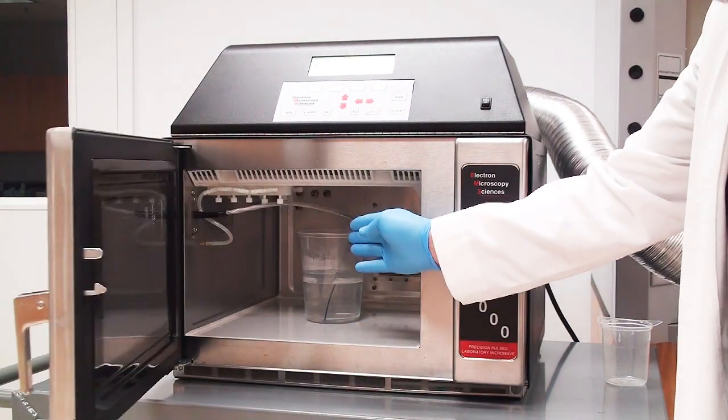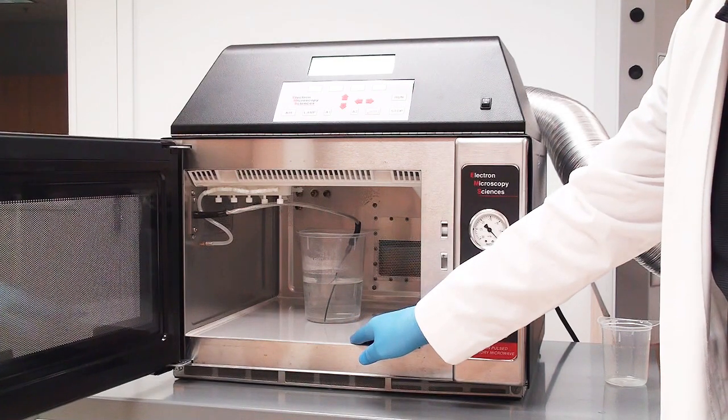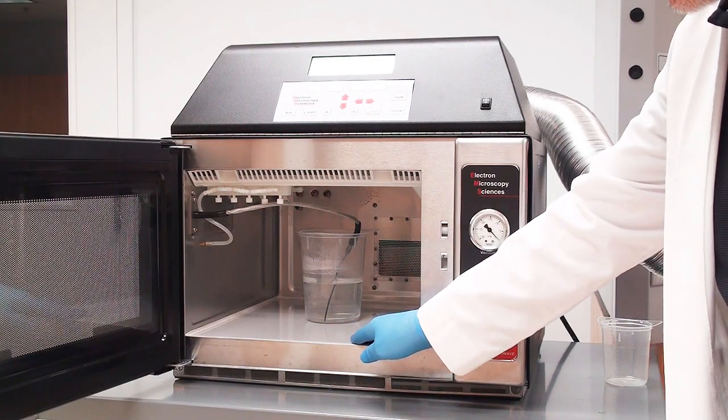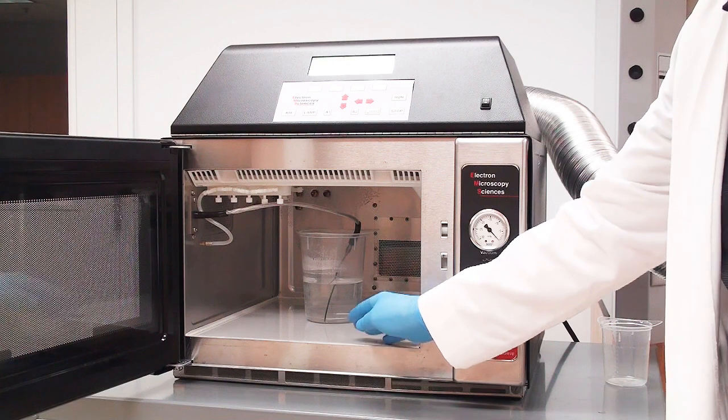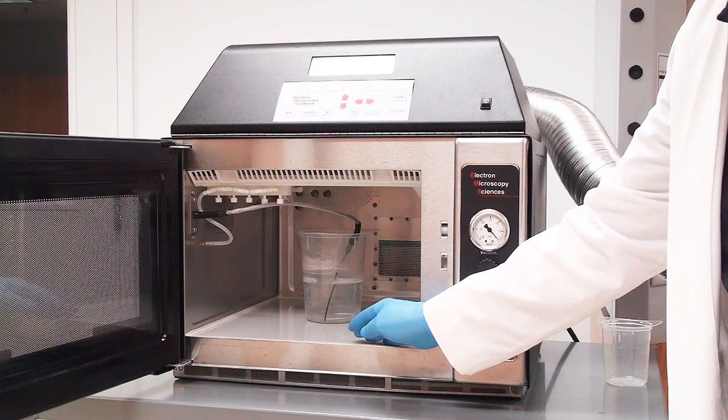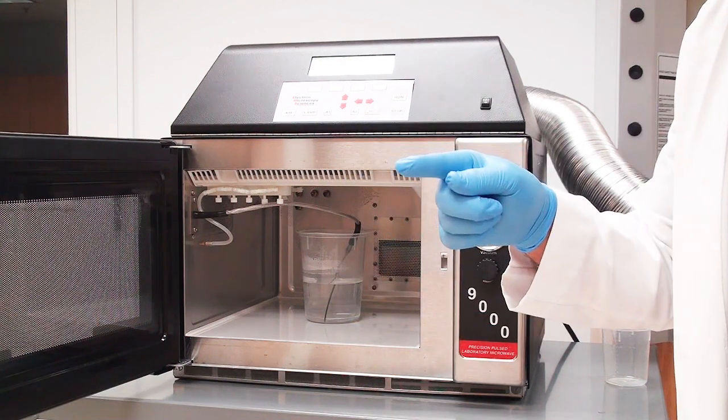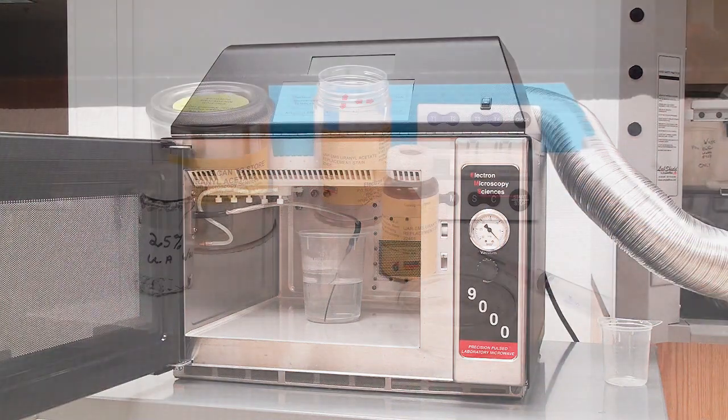I have a water load in there so I maintain a temperature. We're going to be doing 37 degrees versus room temperature. When we go to the benchtop, let's go over there and see what that looks like.